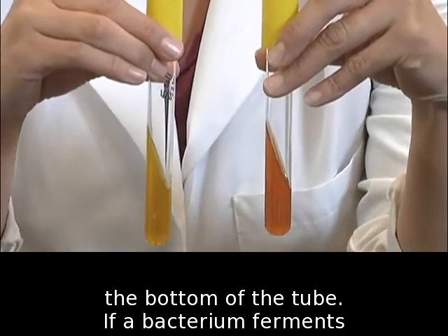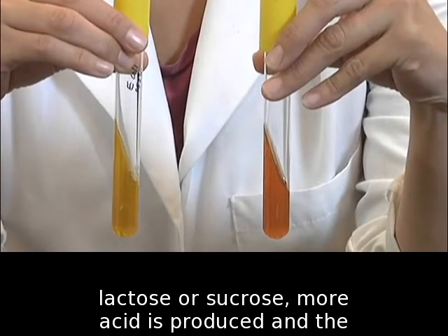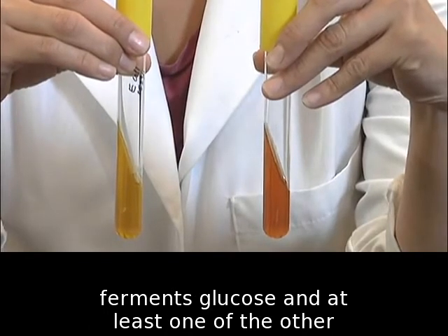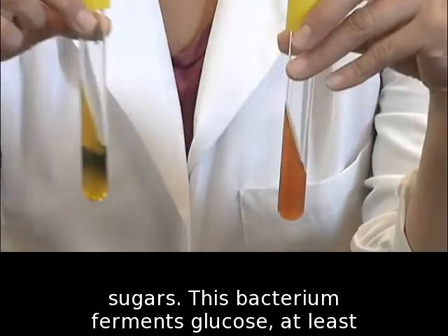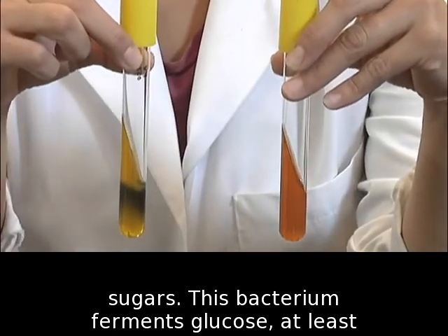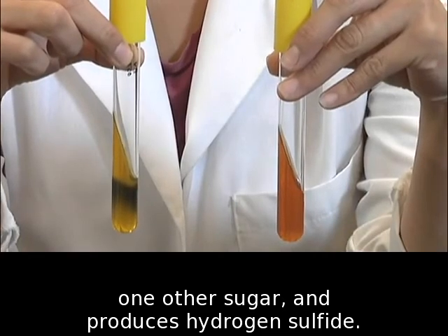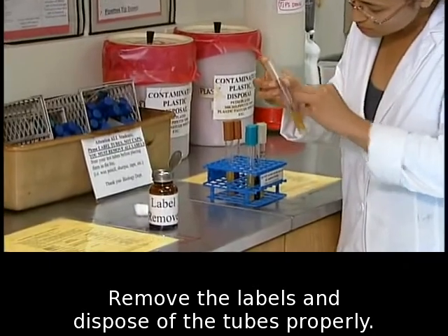If a bacterium ferments lactose or sucrose, more acid is produced, and the slant also turns yellow. The bacterium in this tube ferments glucose and at least one of the other sugars. This bacterium ferments glucose, at least one other sugar, and produces hydrogen sulfide. Remove the labels and dispose of the tubes properly.